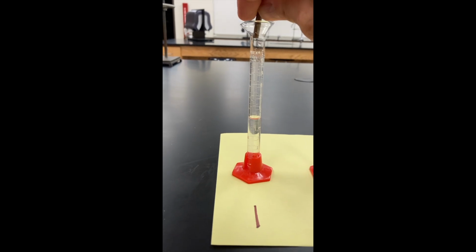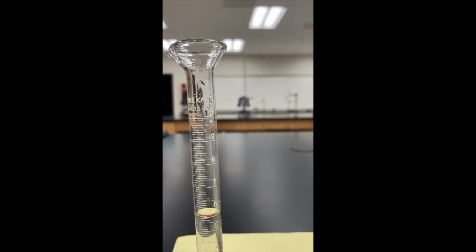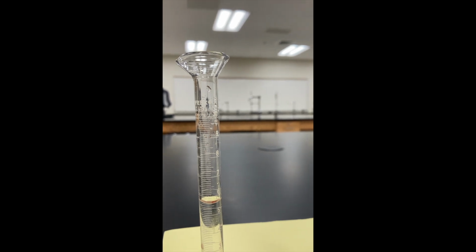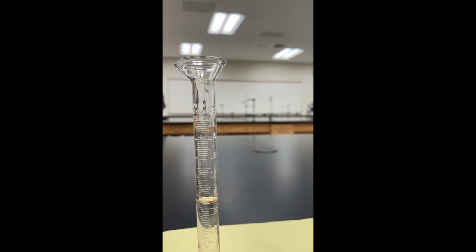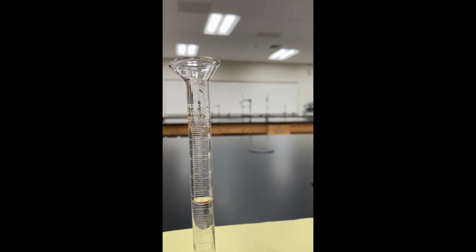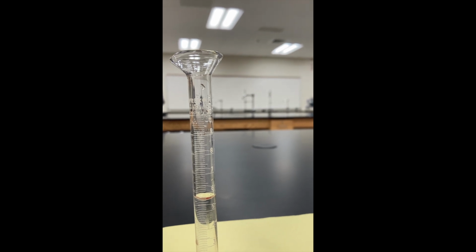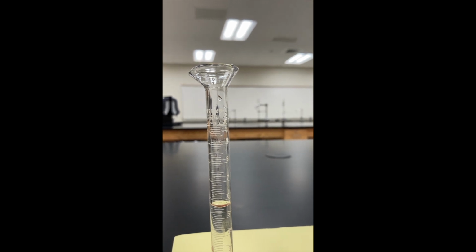Okay, now I'm going to take piece number 1 here and I'm going to put it in the water, and nothing special really happens except that the volume creeps up a little bit here. Oops, let that thing re-establish itself. And if my old eyes are reading this correctly, it looks like it's at 5.6 milliliters right now, because the bottom of the water curve, that's called a meniscus, is at the 5.6 line. So I need you to record that the final volume for piece 1 is 5.6 milliliters.